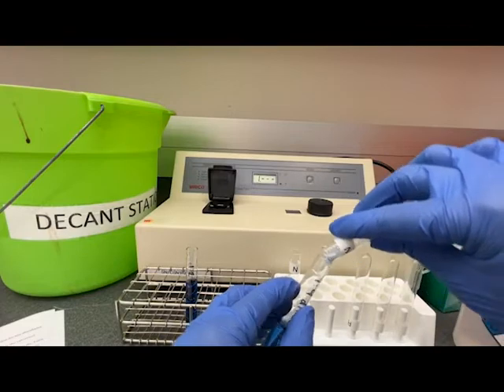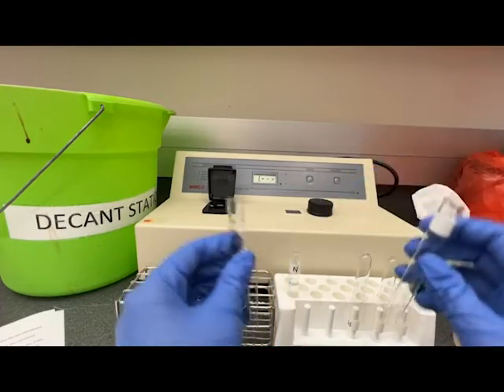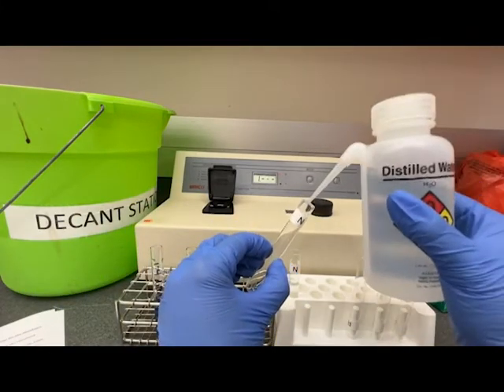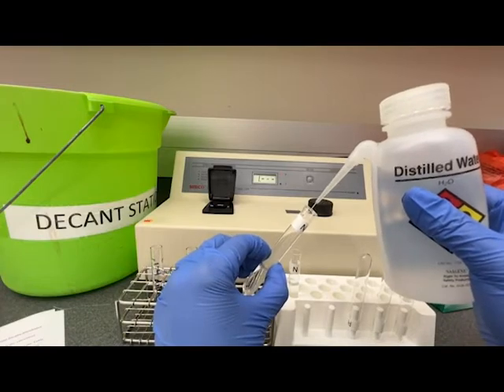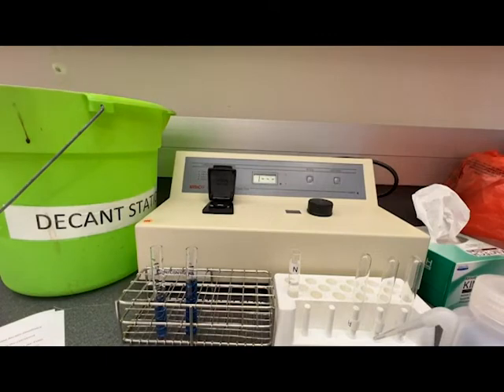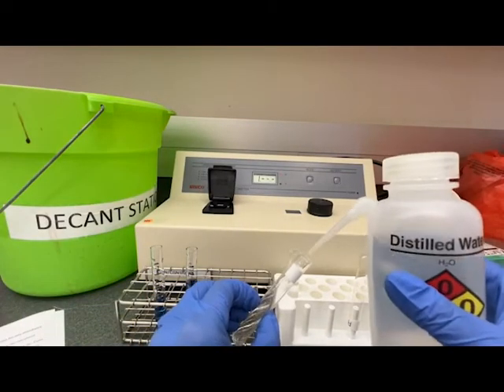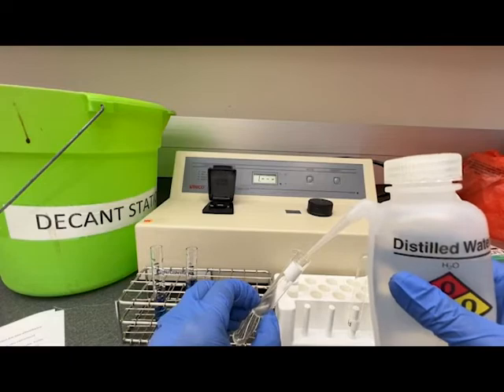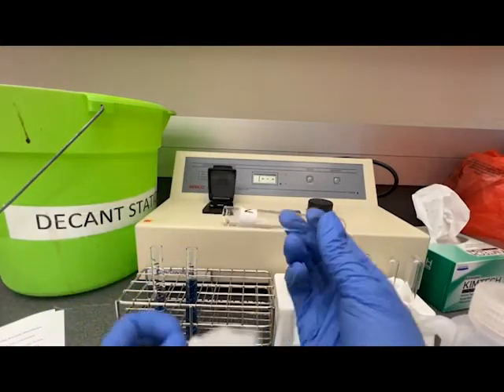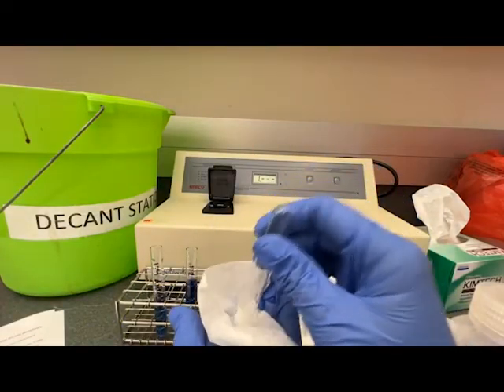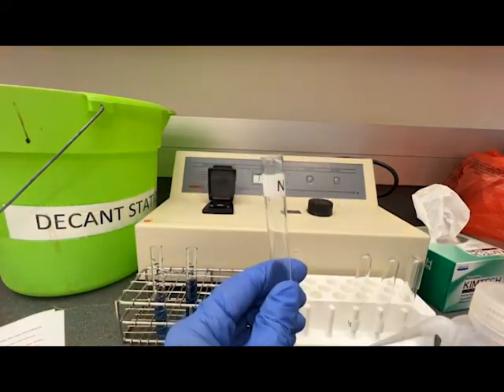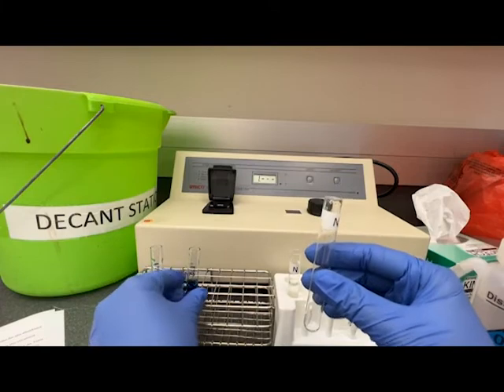We never discard our solutions until we are sure that our experiment has worked. At this point I can take the distilled water and rinse the cuvette and pour it into the decant bucket. I want to gently tap out the extra liquid, not every drop needs to be out, and then I'm ready to transfer the next solution.